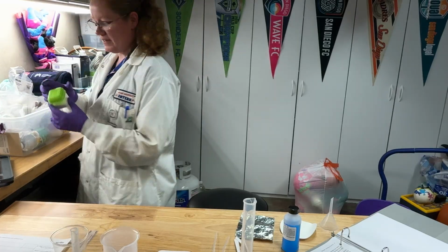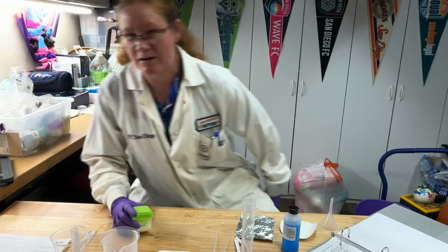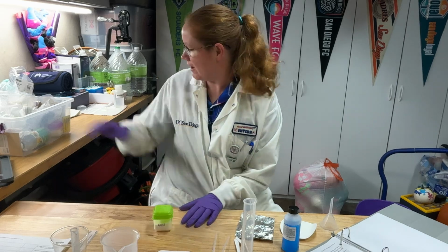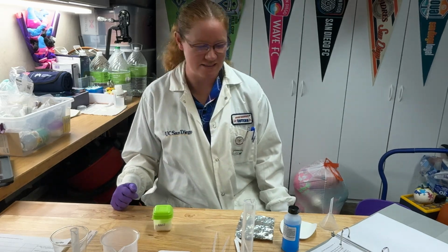All right, so at the beginning of our time together, I mentioned that sodium chloride was a very common item that is used in the lab kit. So I always have a little thing of sodium chloride and actually a little thing of sugar sitting in my supplies so that they're ready to go.